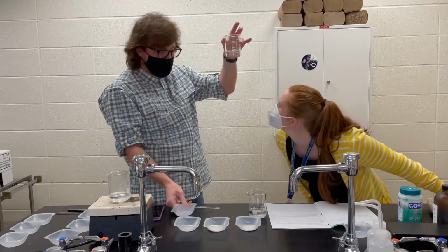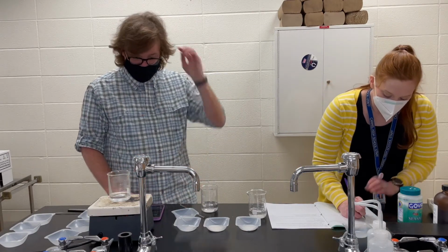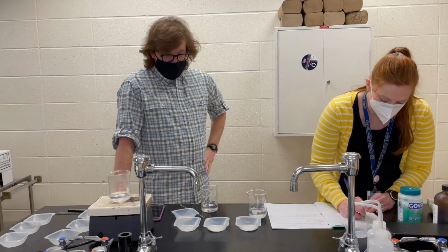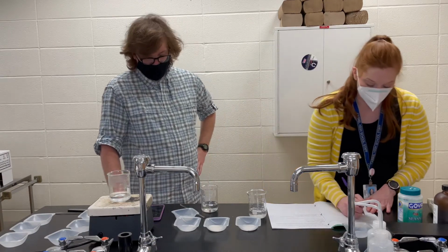I think that looks pretty much all gone. Where are we done time-wise? That puts us at 1 minute, 31 seconds, 31 milliseconds. 131.31. Nice little palindrome. Well, I saw a lot going on in mine. I'm at one, obviously, still going, 145.